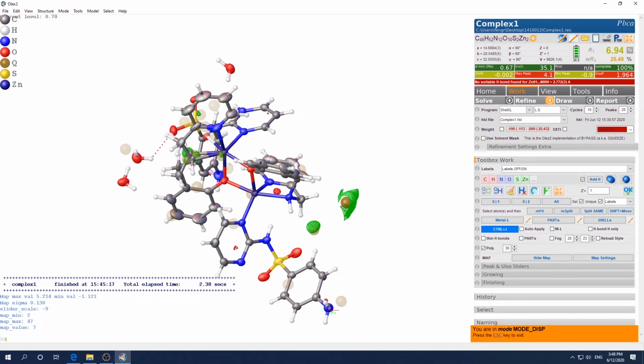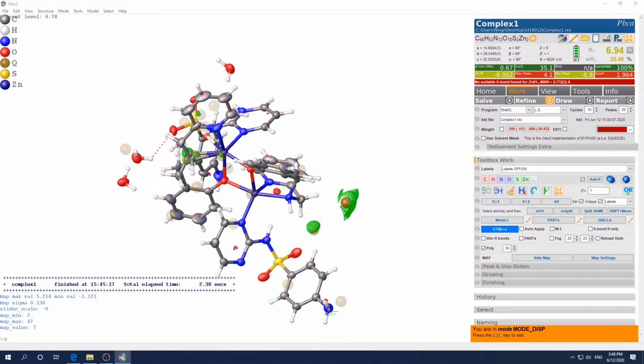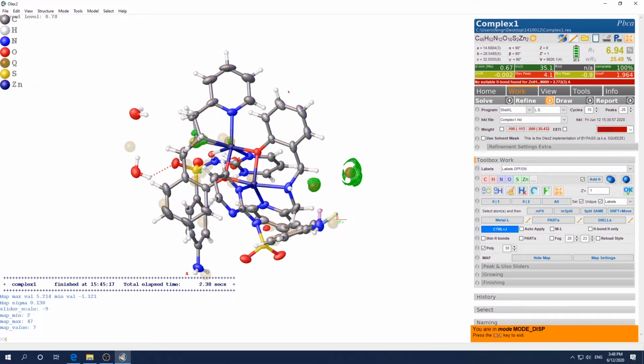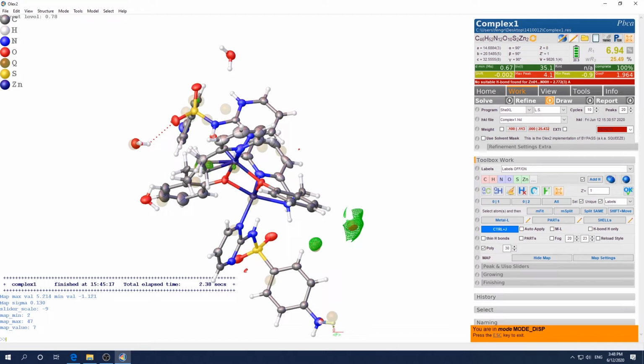So again, of course, before that you have to exit this mode. So just press escape and click this one again. Mode fit. Hold the left mouse button, hold shift, drag, let that go and rotate the view. Do that again: hold shift, left mouse button, drag, rotate. Okay, let it go and repeat this process.